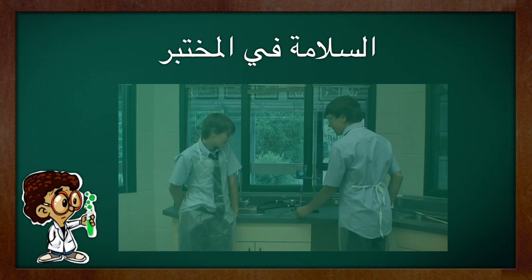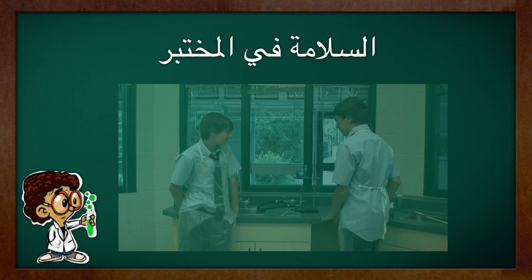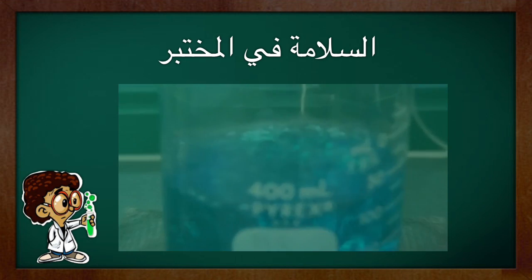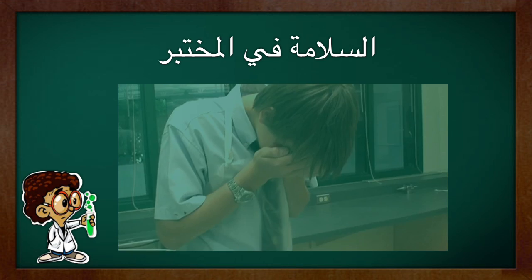Mitchell, should you be wearing your safety glasses? Nah, it's fine. I have eyes like a pop. Oh, Ms. Marcuccio said we have to wear them all the time as we're working on a lab, especially involving fire. Oh my god, Mitchell, are you alright?